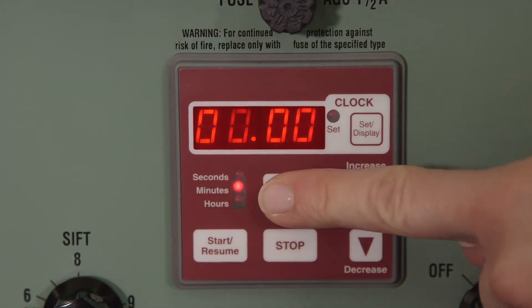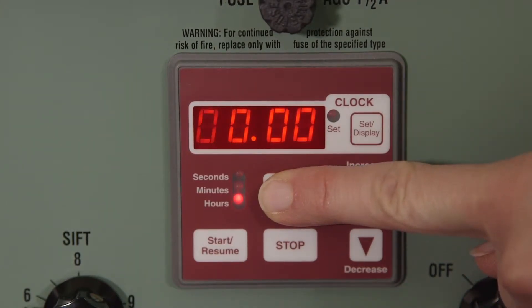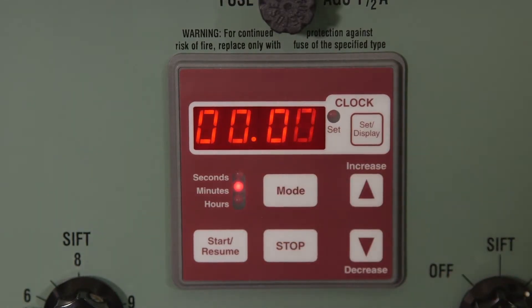Set the sift pulse dial to the pulse setting to engage the vertical tap mechanism. If your test does not require this tap, simply set to sift.